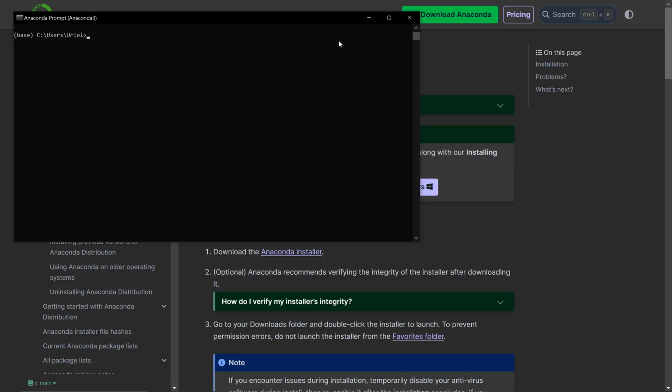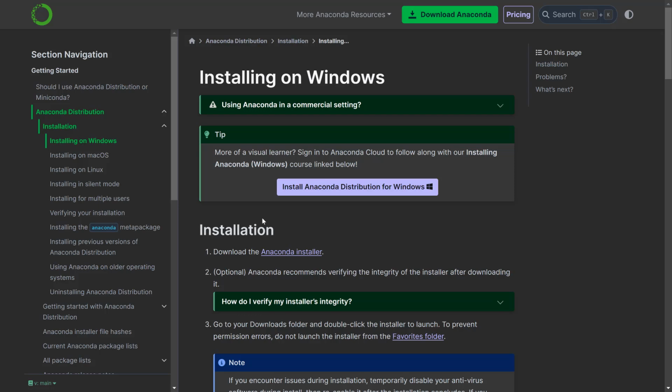And to be honest, it may not make a lot of difference. Once you have it installed, however, you're going to be able to access the terminal and you will be able to be in the base environment. So let's go to Micrometry now.